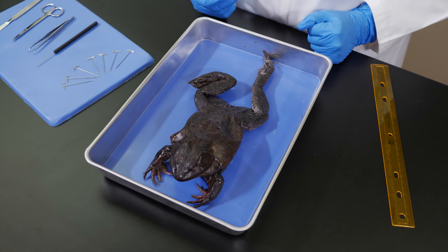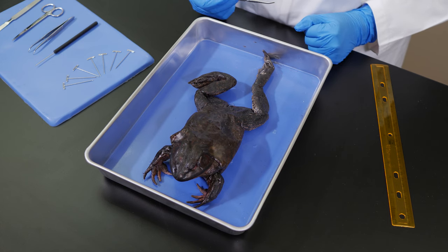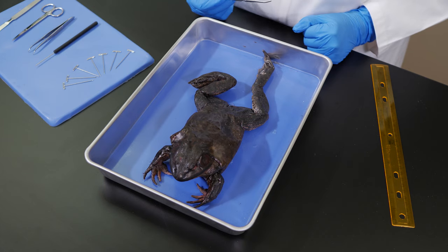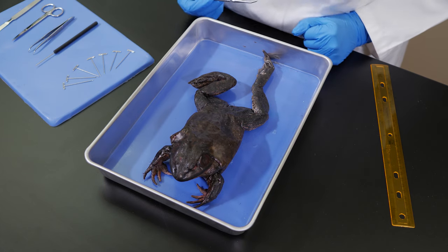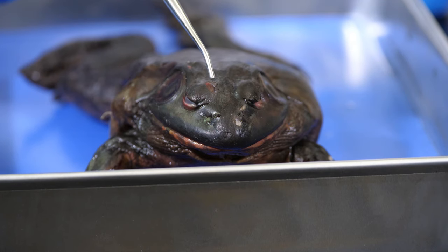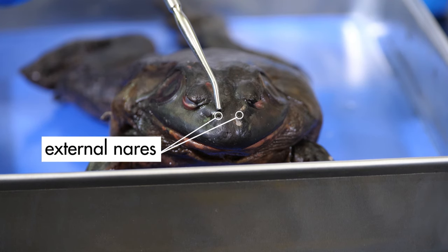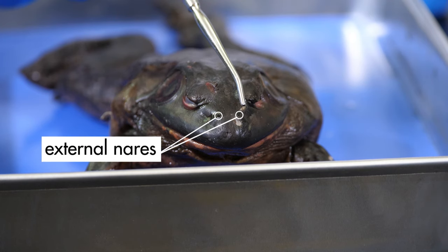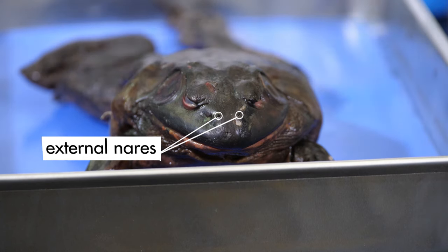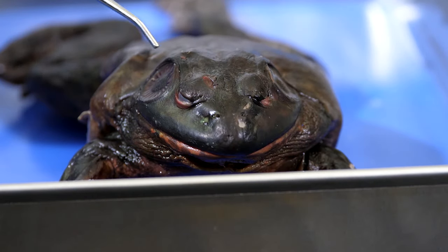Let's examine some of the structures on the head of the frog. In the anterior region of the frog, near the mouth, are two slotted openings. These are the external nares, or external nostrils. Posterior to the nares are the eyes.